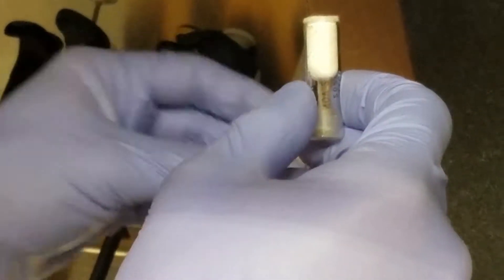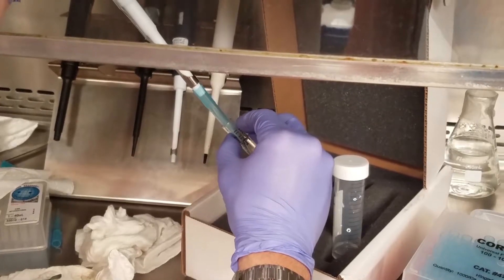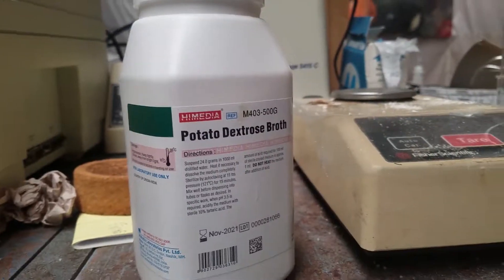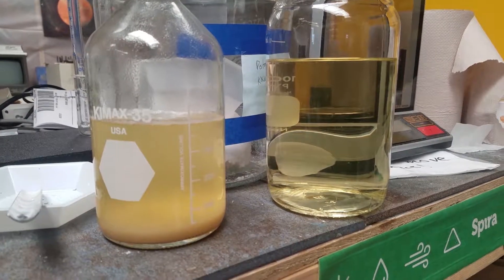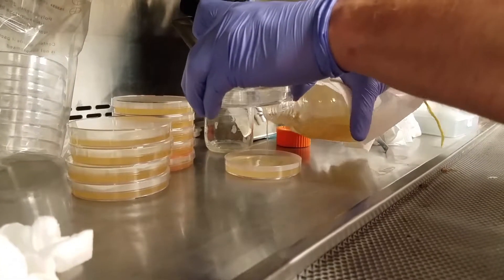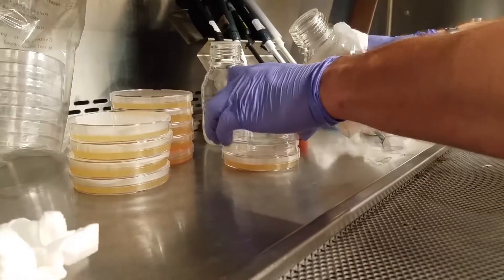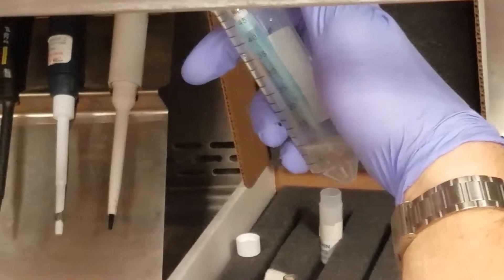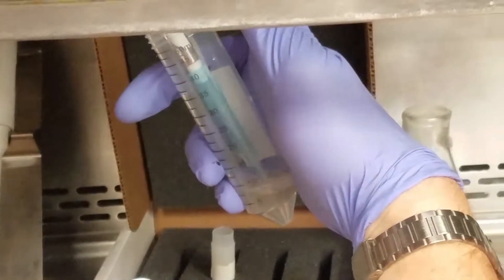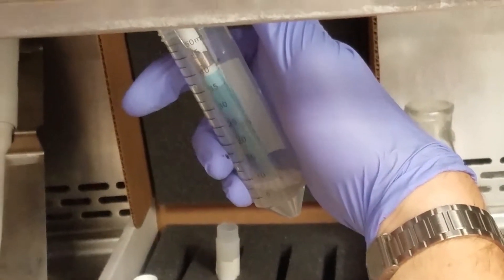We're just starting to make the cultures for laying out the spores in different petri dishes. We have 12, I think. They're all going in the fridge tonight. We have to let the spore rehydrate, and it's beginning.